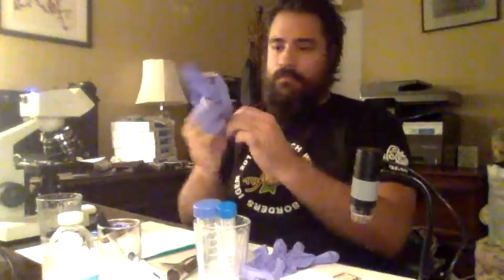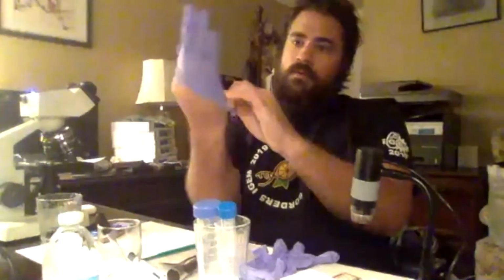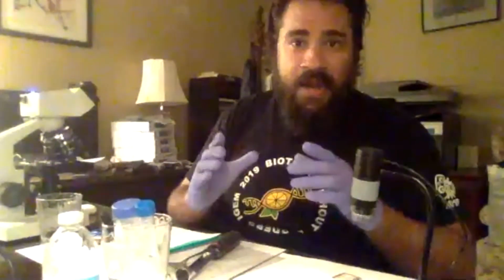So to get myself ready, we have to use proper PPE. I'll put on my gloves. That's the fun part. It's really hard to put on gloves when everyone's watching. It's like the one funny thing. So cool. All right, so how are we going to extract our soil sample?